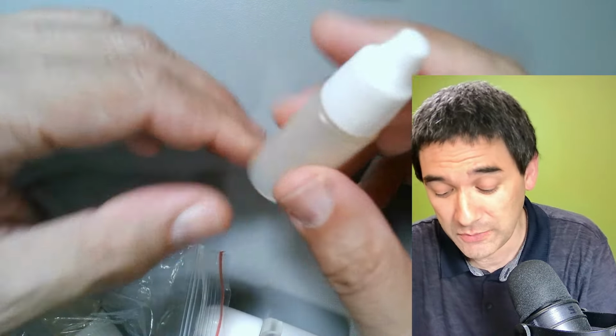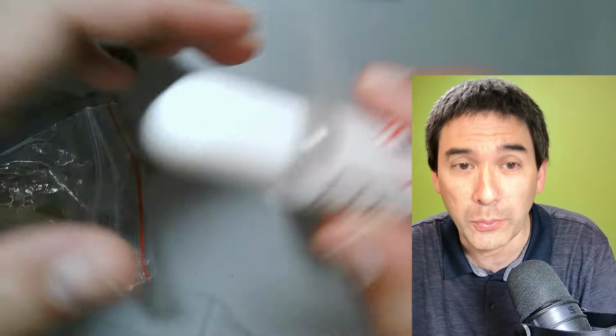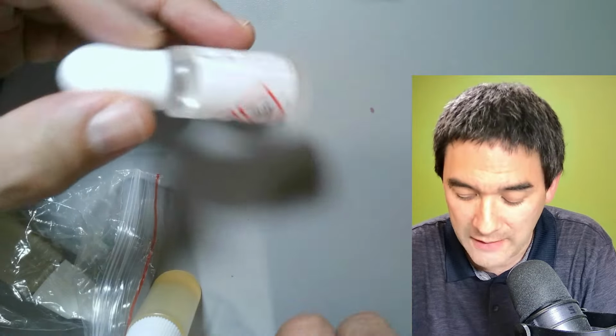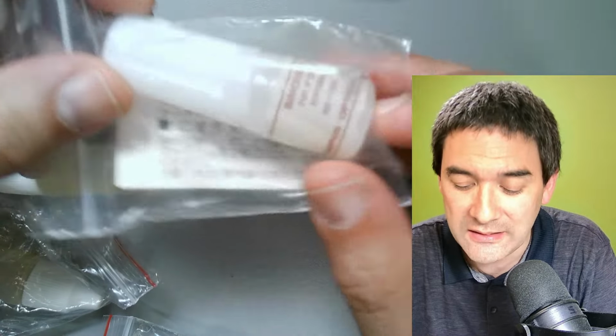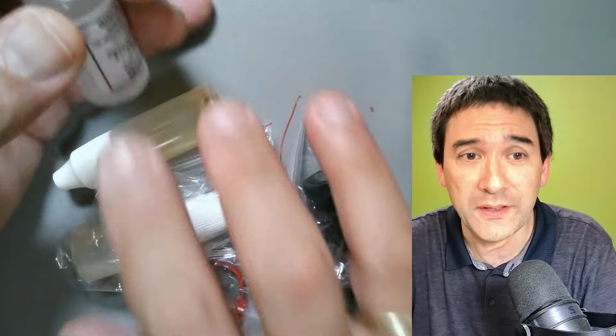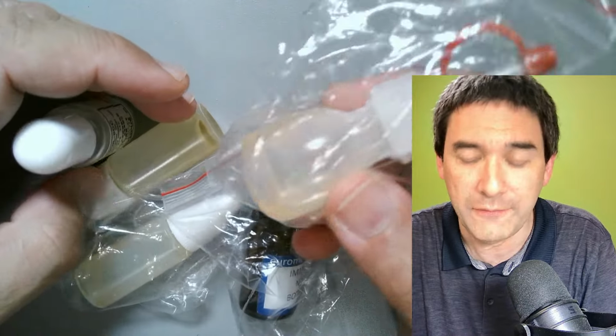I'm going to talk a little bit about that. And over here I've got 2 bottles of synthetic immersion oil, and they have remained liquid. This one, for example, since the year 1998. So for a very long time, it's still usable. I'll be talking about this as well, but simply to give you a little bit of an insight of what I have here.